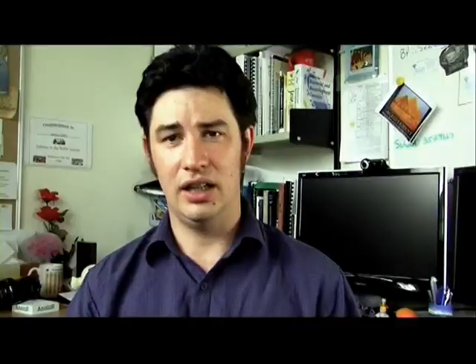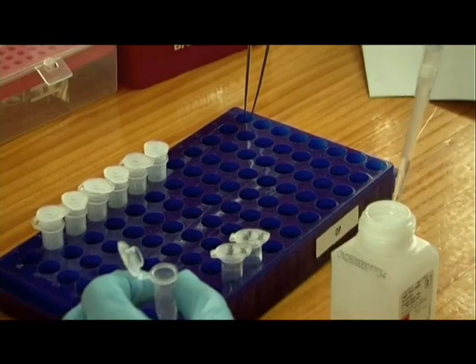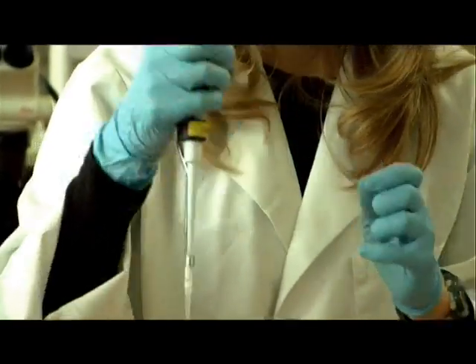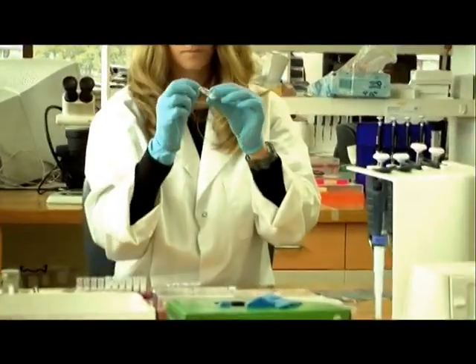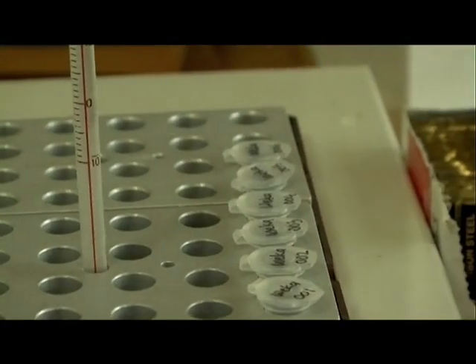First the tissue must be broken down and the cells lysed to release the DNA. This is done by digesting the feather tip with an enzyme. This digestion is carried out in a buffer that will stabilize the DNA and inhibit the enzymes that are released from the cell so that they do not break down the DNA. The digestion is incubated at 55 degrees for a couple of hours. At this temperature, the digestion enzyme is still active, but the enzymes released from the cell are mostly inactive.